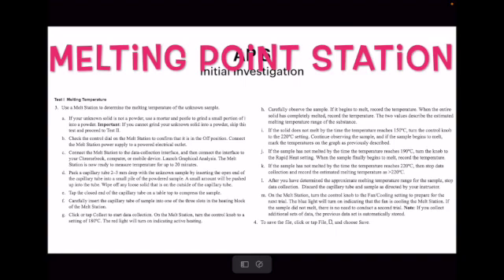to share the melt station, so this is one that you may have to work with other teams so everybody gets access to it. But you're going to learn how to set up your melt station, and you're going to proceed to test your substance in the melt station. This should take you about 10 to 15 minutes at this station alone when you're running your tests, and somebody has to stay there and watch it. So please do not go past the limit on the melt station.